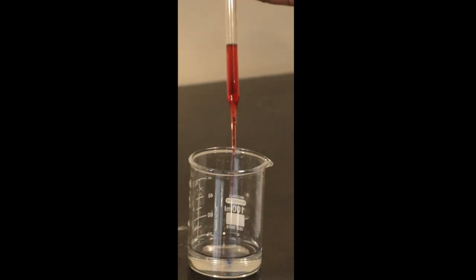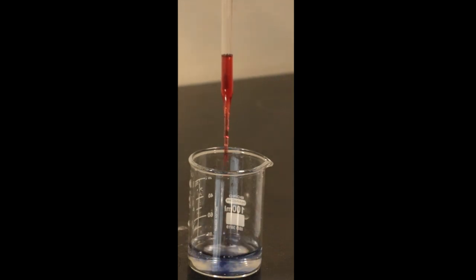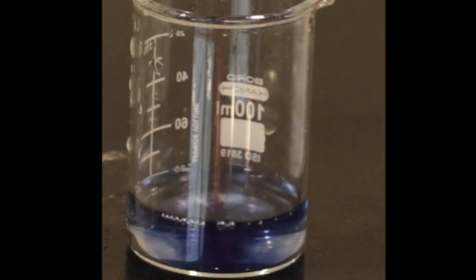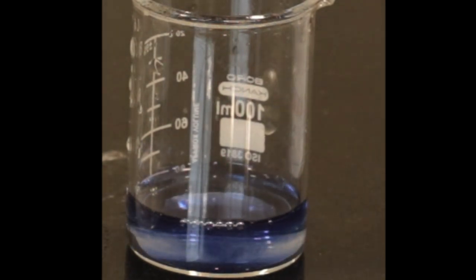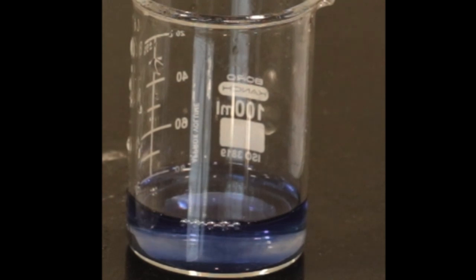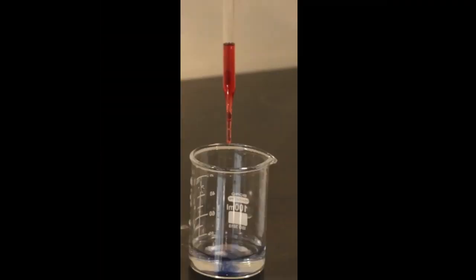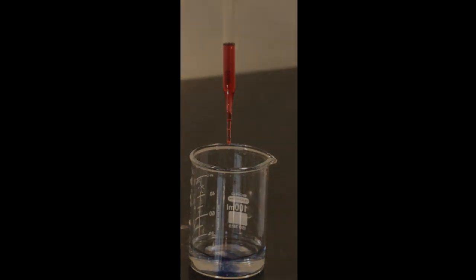When this red color solution mixes with this liquid, its color changes to blue. You might be wondering, what kind of magic is this? But no, this is just a chemical reaction. This red color solution is litmus, and when it comes in contact with a base, its color changes to blue. So let's talk more about litmus.